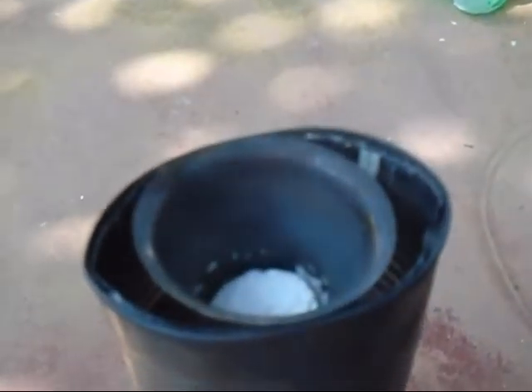At last, you can see here nice crystals of boric oxide, and you can see water vapors coming out. Now you can see the boric oxide — it looks like glass. So now we powder this boric oxide and can go to our next step.